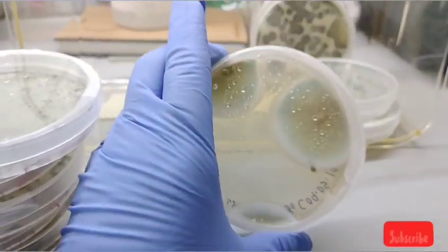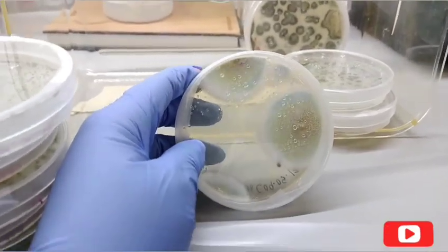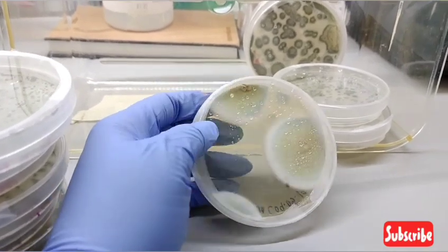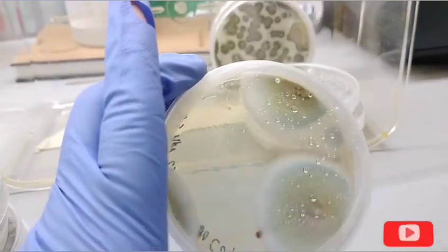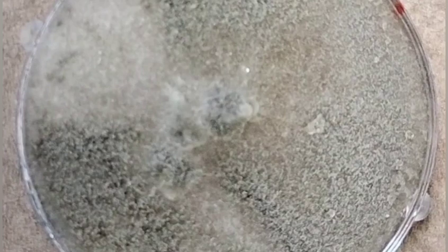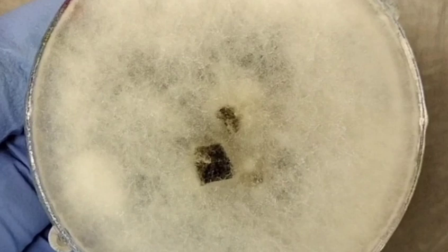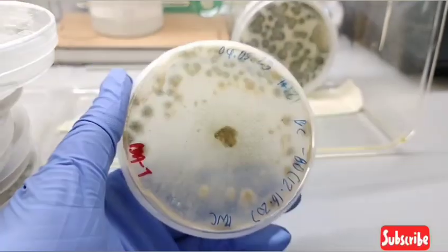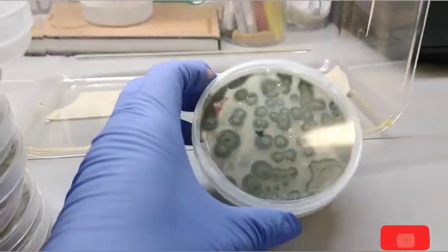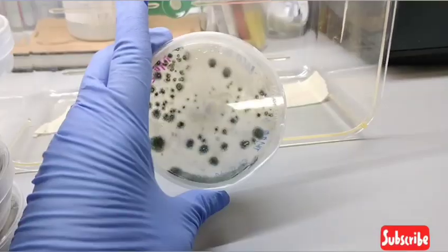So how do I know it's contamination? Because I have an idea of what the cells or the colony should look like on agar, and it's not this. It doesn't sporulate like that. So I'm going to go through and see if I can grow it up again and get a pure culture. So hopefully that happens, because this is not it at all.